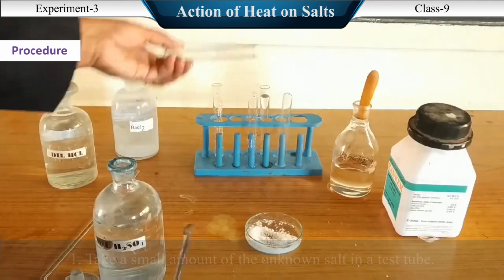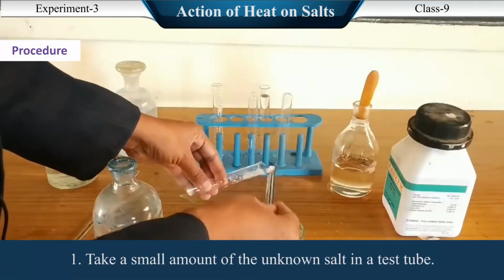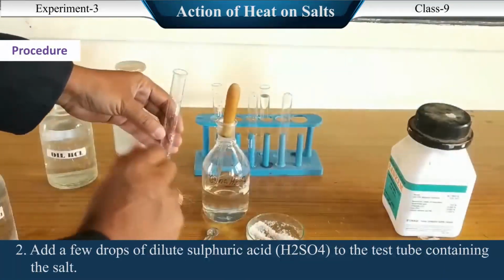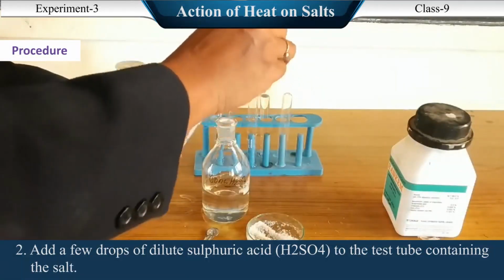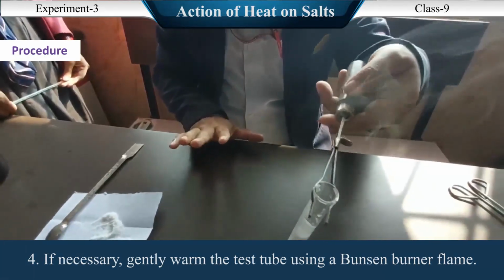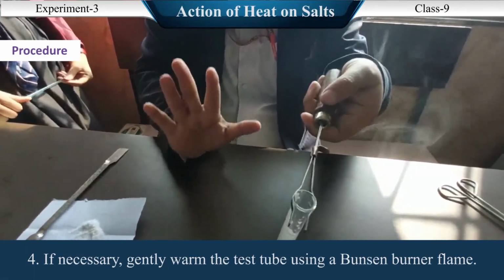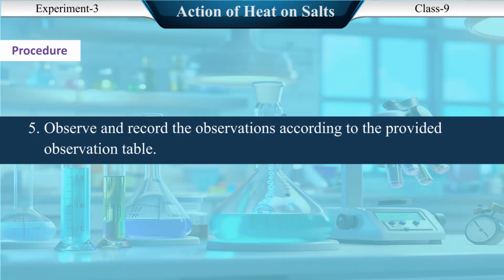Procedure. 1. Take a small amount of the unknown salt in a test tube. 2. Add a few drops of dilute sulfuric acid to the test tube containing the salt. 3. Shake the mixture well. 4. If necessary, gently warm the test tube using a Bunsen burner flame. 5. Observe and record the observations according to the provided observation table.